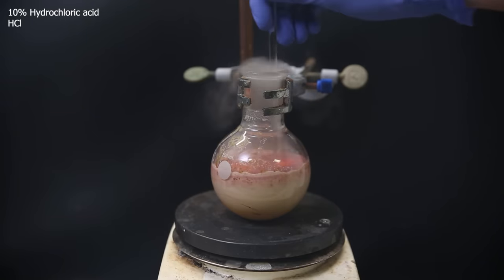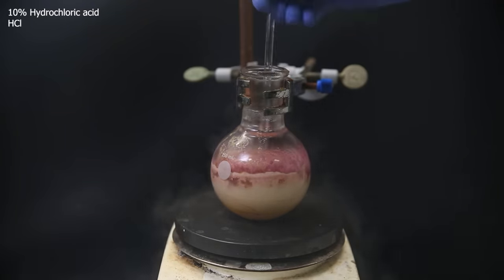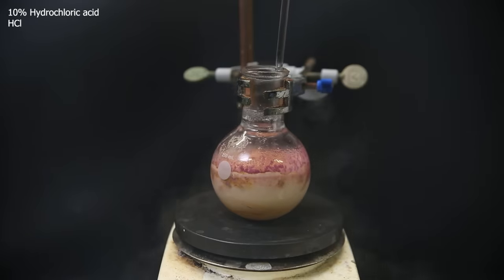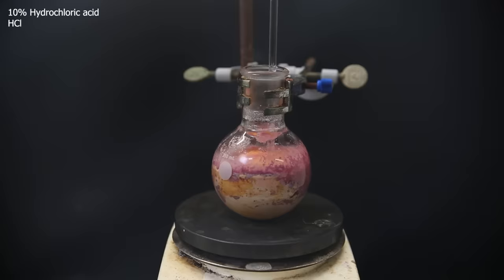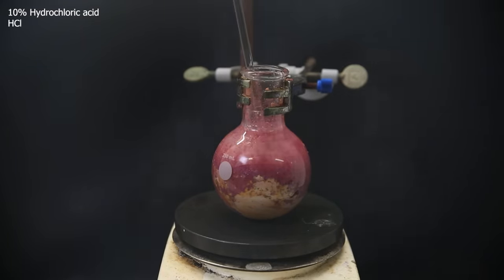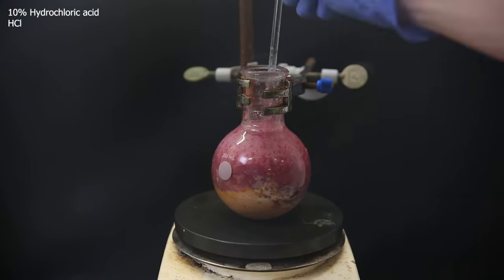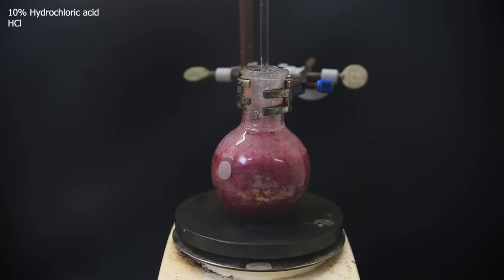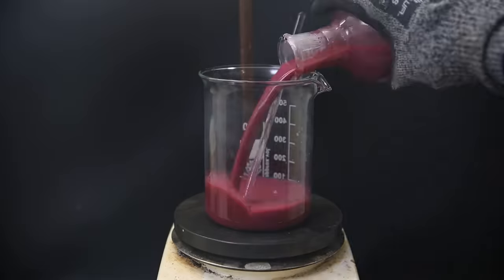Quickly an exotherm takes place that boils off a bunch of 1,2-dichloroethane and expels some hydrochloric acid. It is best to do this slowly in an ice bath to keep the temperature down, but I'm too impatient for that, so I just keep adding it and mixing it in. When it no longer seems to react, I add a bunch more on top. The mixture has turned pink.